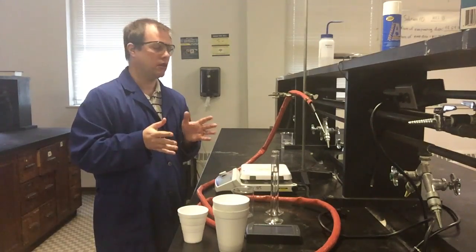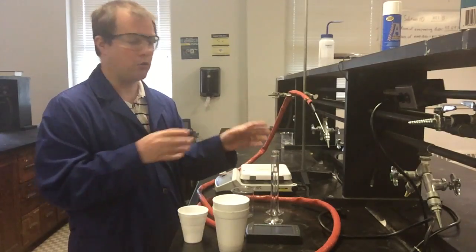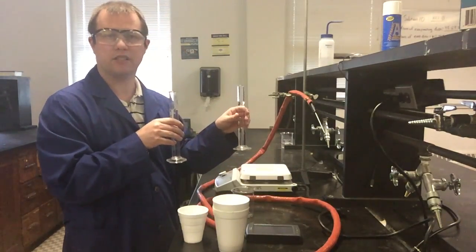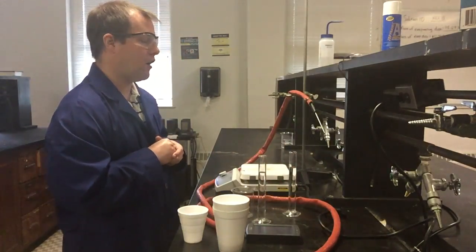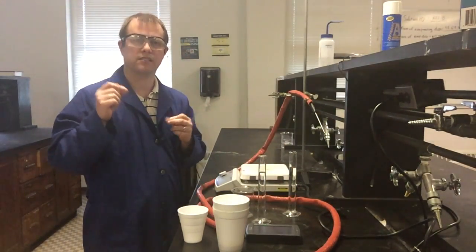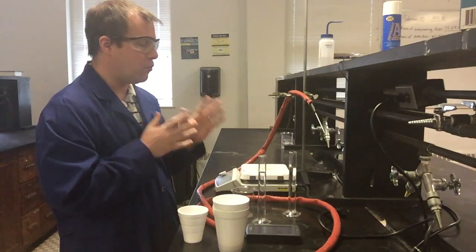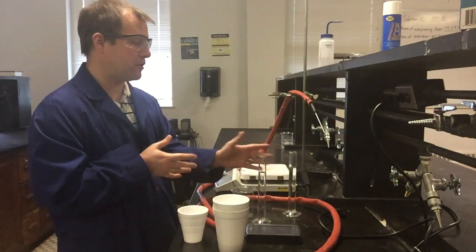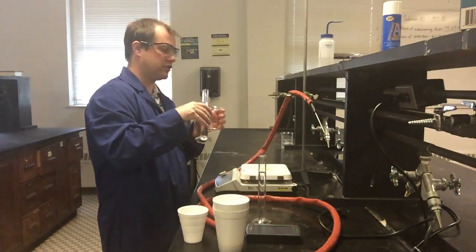So in general, looking at the first part of our experiment, we just want hot and cold water. So I have two different 50 milliliter graduated cylinders filled pretty much right at 50 milliliters, just a little bit different. I'll have these exact numbers in a table that'll summarize all of this at the end and go over things like I've done before too. And what I'm going to do is basically just take 50 milliliters of the hot water. So I'm going to take my 50 milliliters here of the hot water, and this one's actually just under 50.